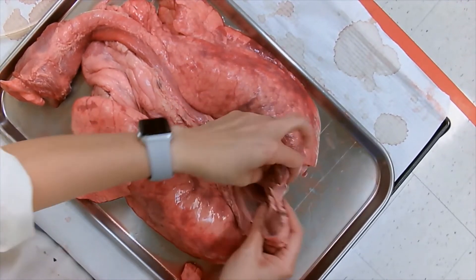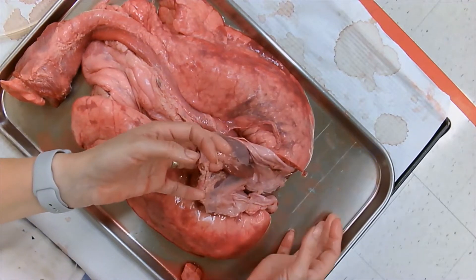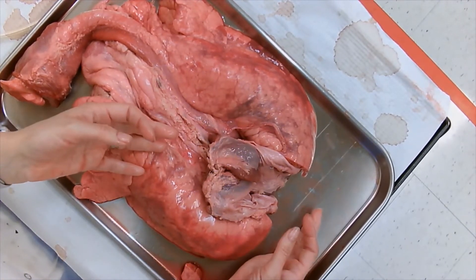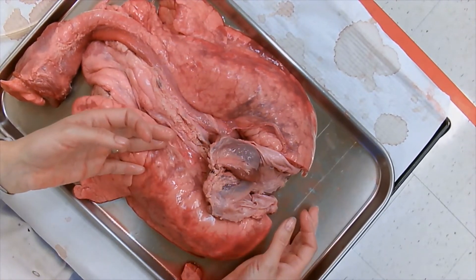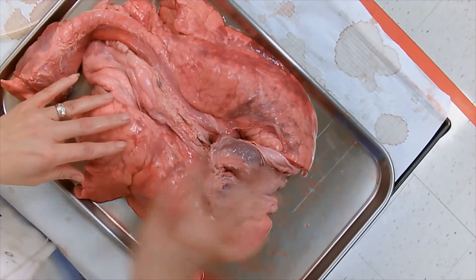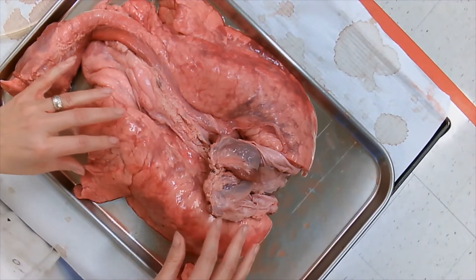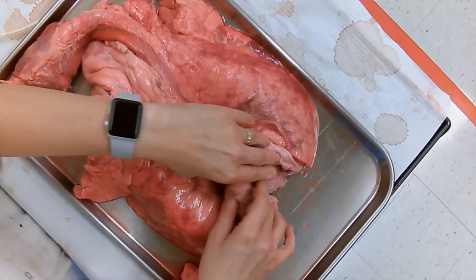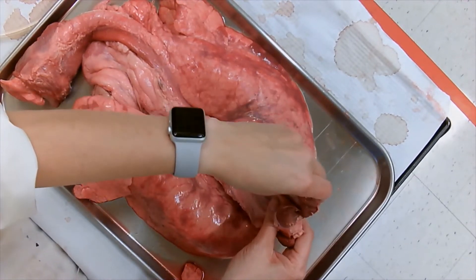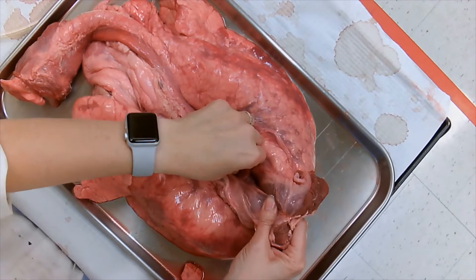It's usually closed but it can actually open. This is one of the sphincters attached to your stomach, and it makes sure that when you eat your food and it's inside your stomach, if you go lie down or do cartwheels after eating, the food doesn't just go back up into your mouth.